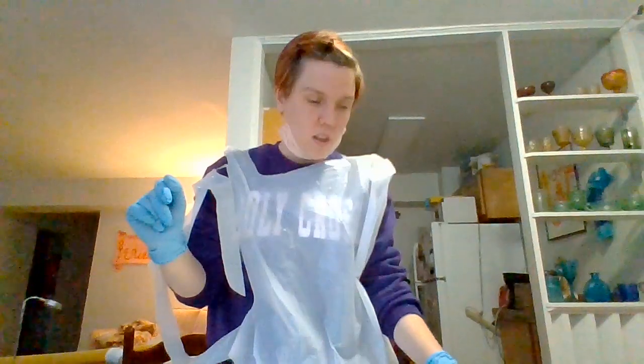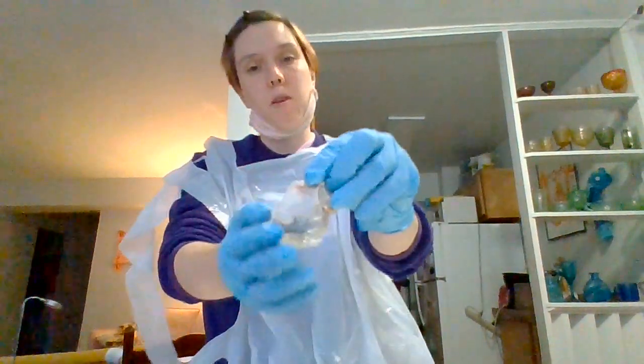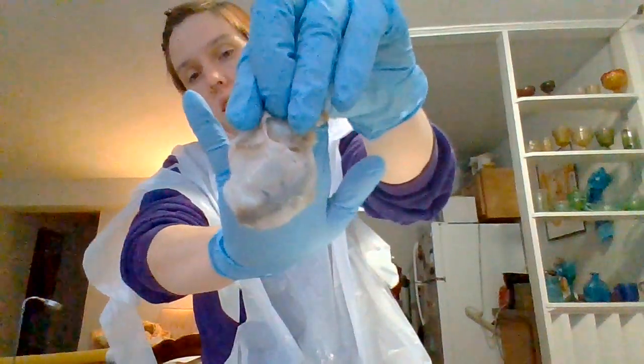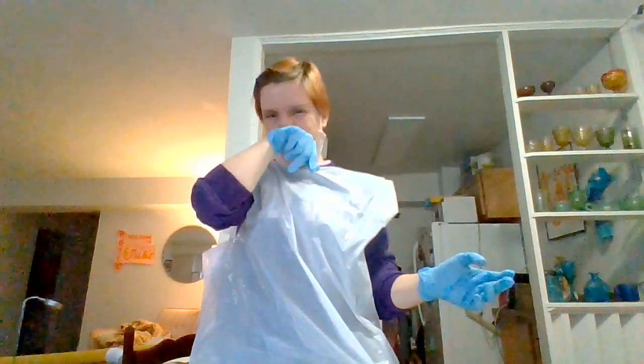Okay, hi. So the first thing I'm going to show you, which I sliced off the brain, is the meninges, which I'm going to hold better this time so they don't fall on my laptop. You can see it's the membrane around the brain. I was really surprised by how thick they were. I guess I just wasn't expecting that.